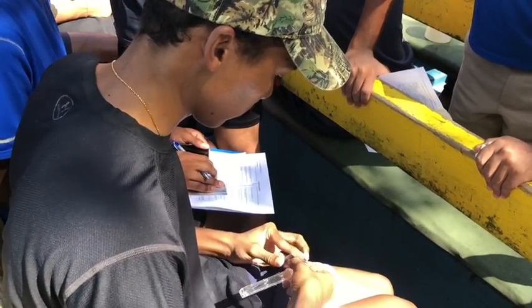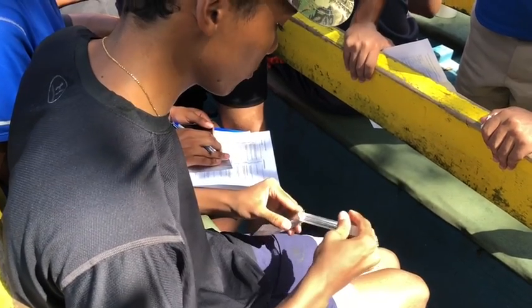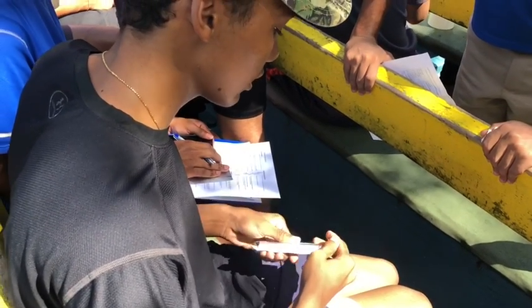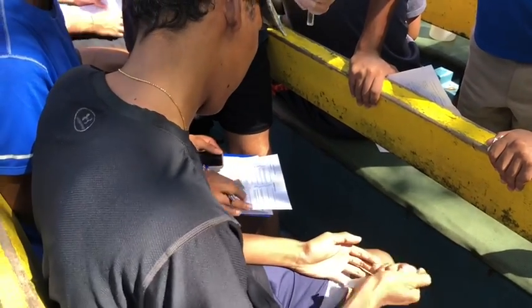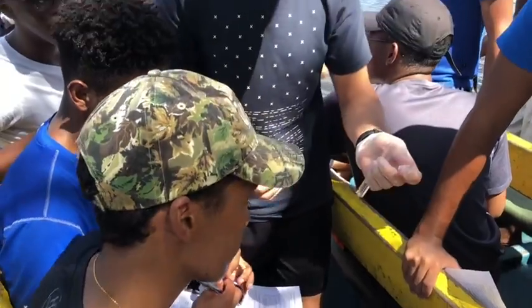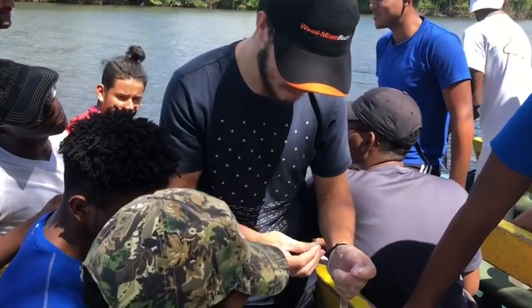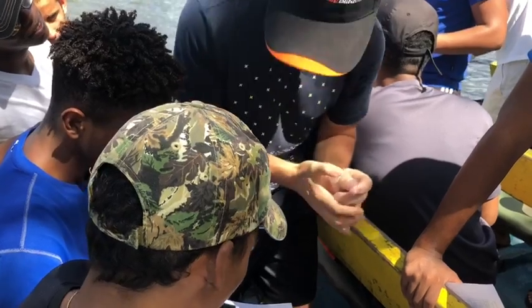Now, why are you putting it in that sack? Because if you don't put it in the sack to block sunlight, it will react with sunlight and cause it to change color. This is the nitrates — it's the same test, smaller — so let's put the tablet in. It reacts with the water and then you put it into the sleeve.